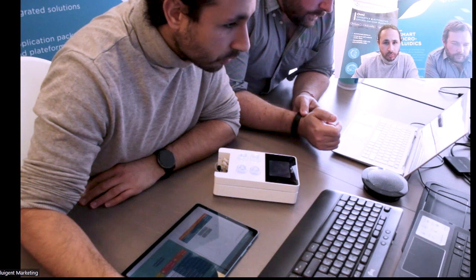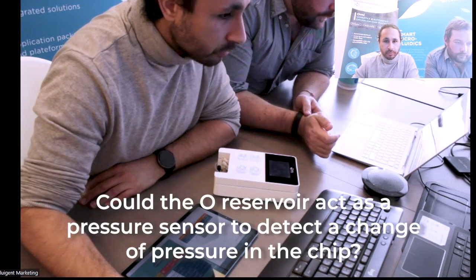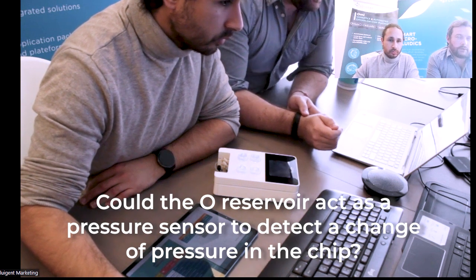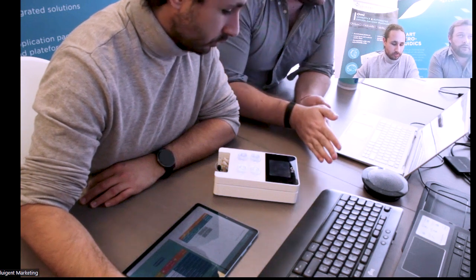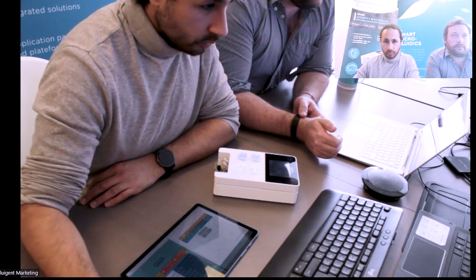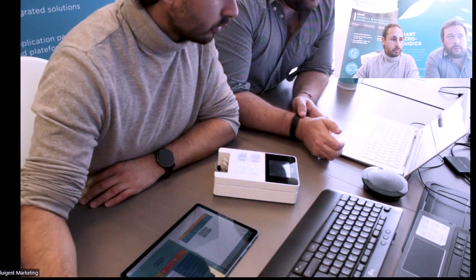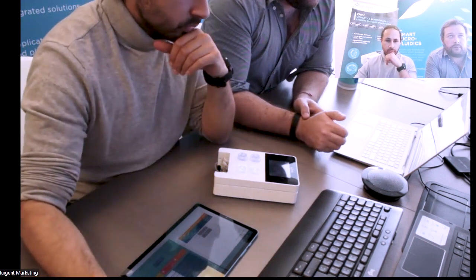And finally, last question: could the reservoir act as a pressure sensor to detect change of pressure in the chip? There is actually only 1 pressure sensor in the system, which is used to regulate the pressure at the output of the pump, so the pressure set in the pressurized reservoirs.